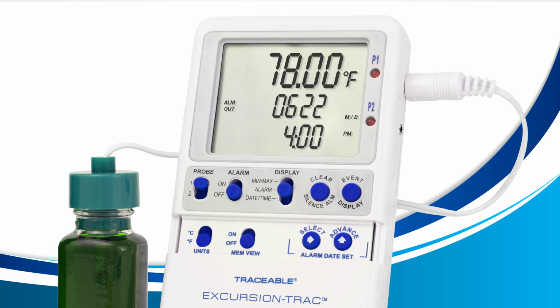Now that we know what alarm out means, let's learn what alarm in means. Press the event display button while viewing your alarm out to view the alarm in. The alarm in is when the temperature that was out of range earlier returns back in between the low and high alarm range. In my case, the top says 78 degrees Fahrenheit, which means that the current temperature came back underneath the high alarm of 78 degrees Fahrenheit.